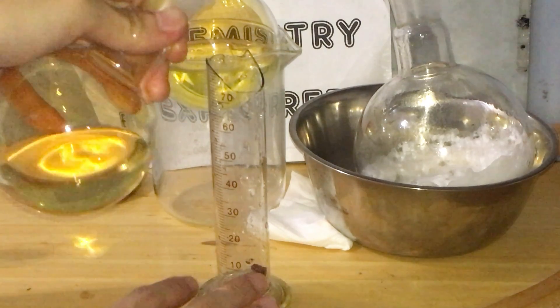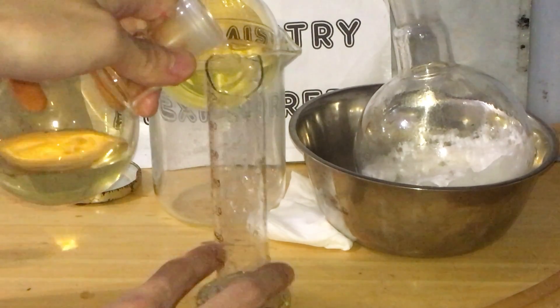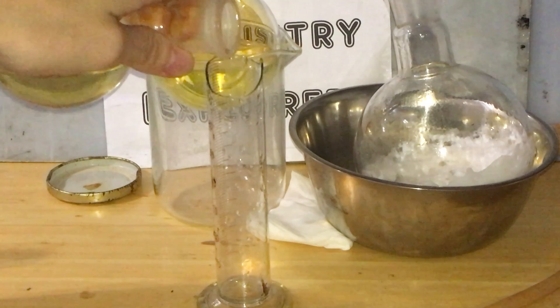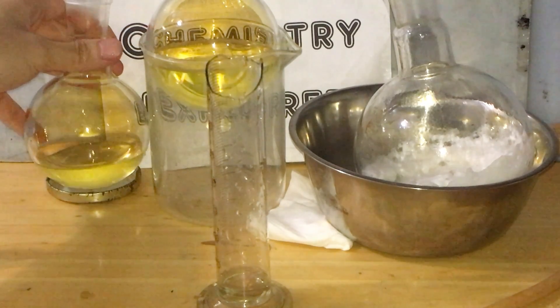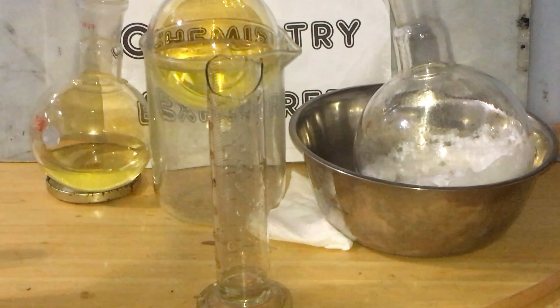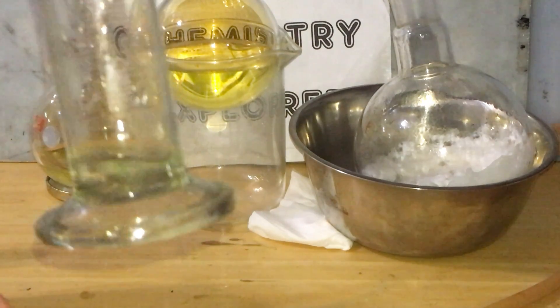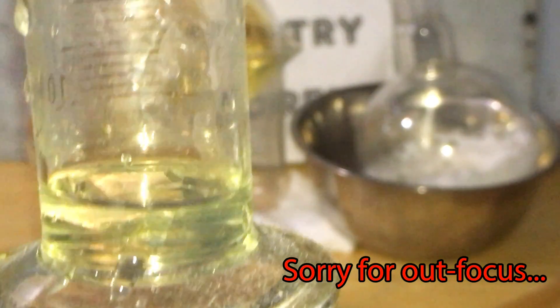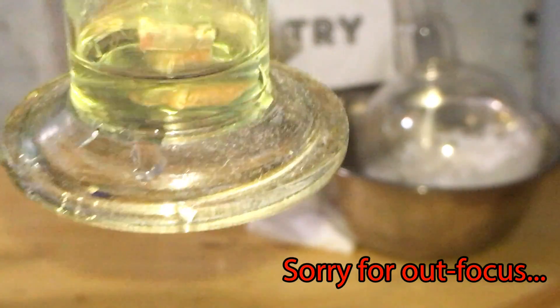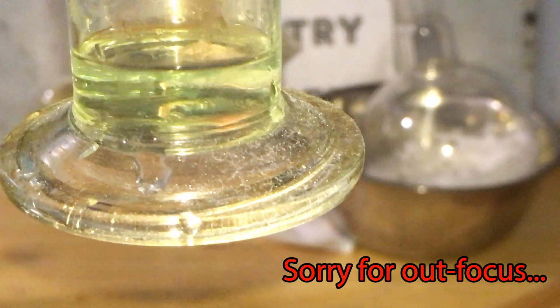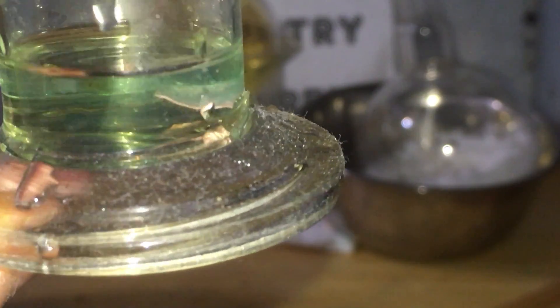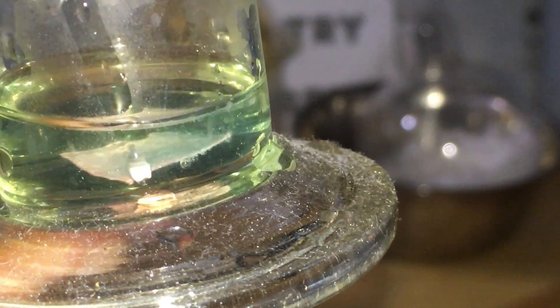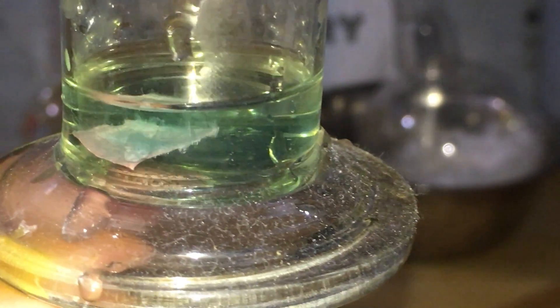A piece of copper is placed in the graduated cylinder. Some of the product is added to the cylinder. As you can see, there are some bubbles and the solution turned pale blue due to copper 2 ions formed. The gas formed is a little bit brown, which is nitrogen dioxide. This proves that the acid is moderately concentrated. It can be concentrated by second distillation if you want to.